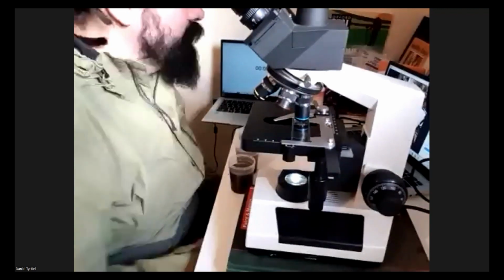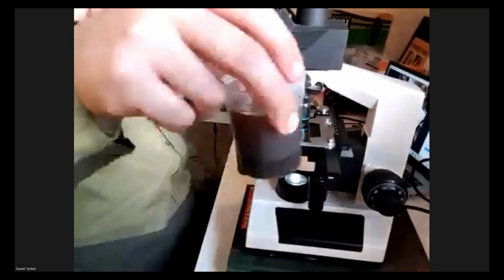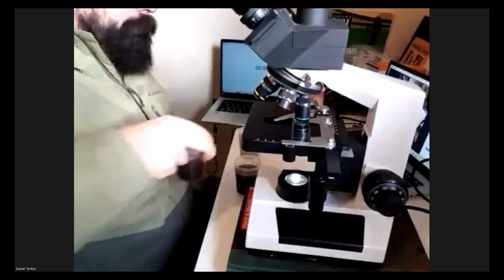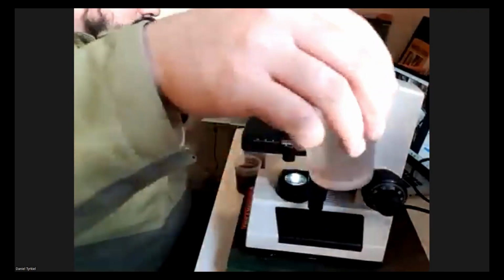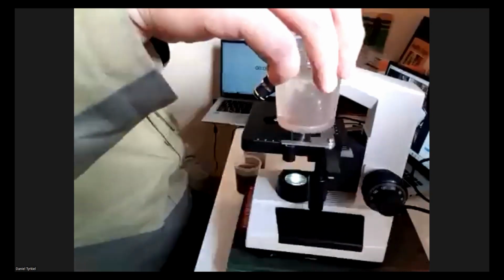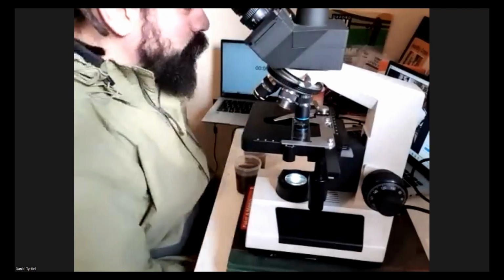Let me just quickly run through. Oh, sorry, go ahead. We were on the main count. We'd finish up by taking the sample. Let's say it looks like this, and we dilute it until it looks like that. And then eventually we get to something that looks like this. Then we do our bacterial count, and that would conclude the assessment. Just wanted to touch upon that before we go into questions.